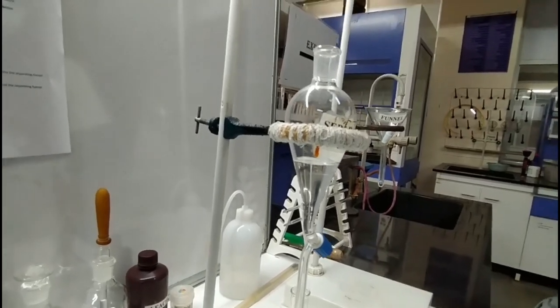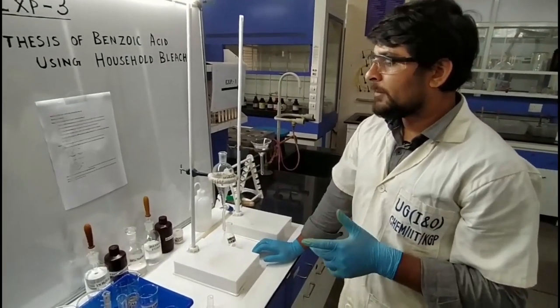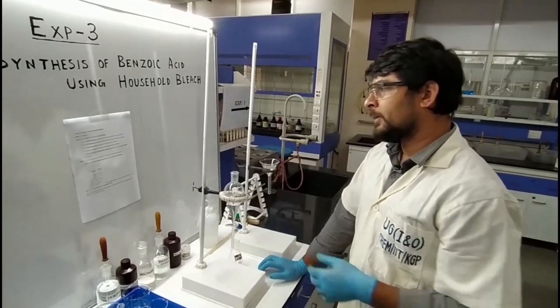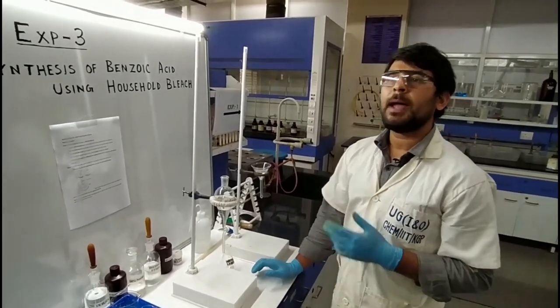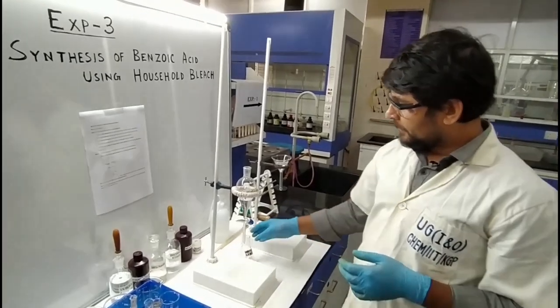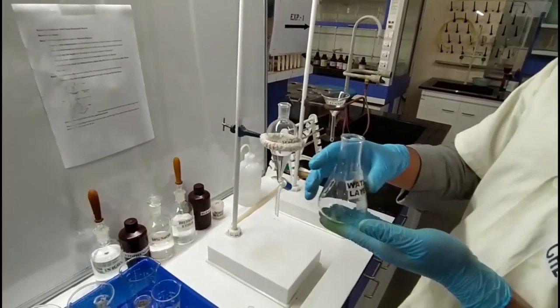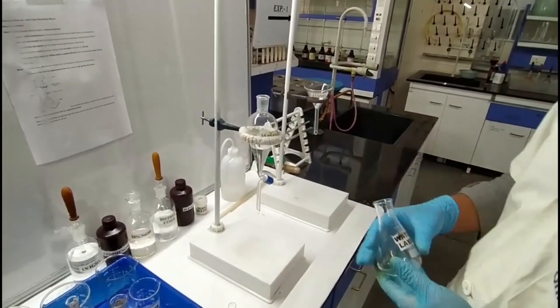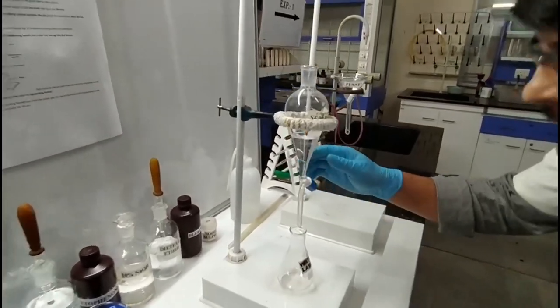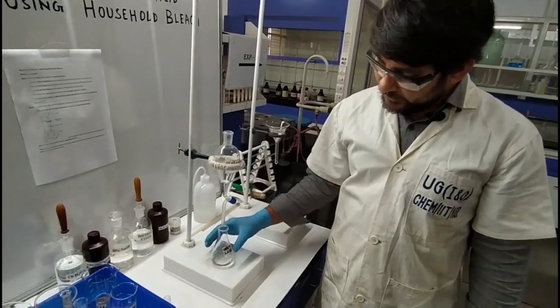Our intention is with the aqueous layer, because in this reaction the sodium salt of benzoic acid is prepared, and that sodium salt is soluble inside the aqueous layer. So we have to take the aqueous layer from the separating funnel into a container labeled as the water layer or aqueous layer. This is the conical flask. I am going to transfer the aqueous layer into the conical flask — all the lower aqueous layer is now transferred inside the conical flask.